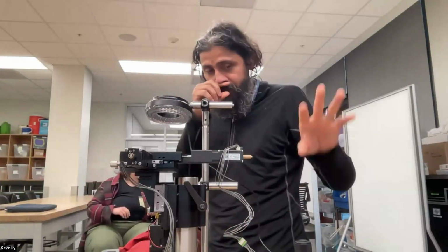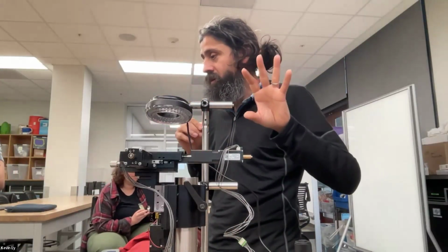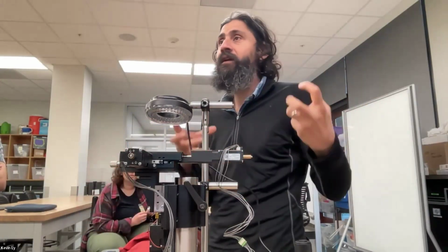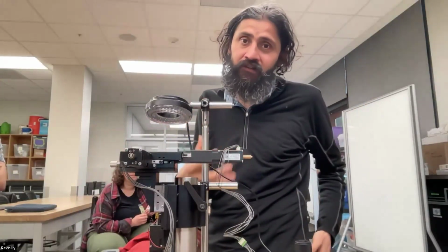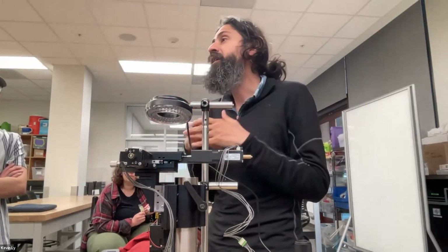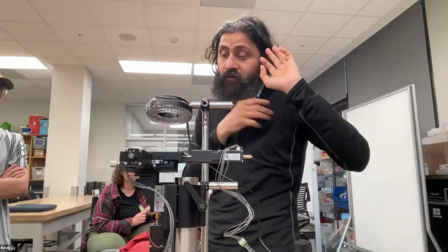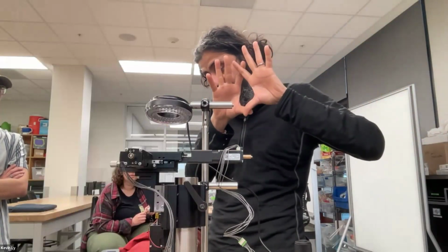But one of the threads around this is it's a Python stack, and I'll talk about that in the class separately, because some of you can realize that, oh, I'm getting for free 5 different motor controls, all the light control, trigger control, time lapse. How do I fork the SQUID code and build it into something? That's the point. The purpose I'm spending some time on these projects is we can fork them and build new things with it. So you don't have to then learn, and you should learn, but sometimes in the undisciplined learning approach you want to get something working so you're hooked onto it. Also there is a Qt Py stack for the visualizations.